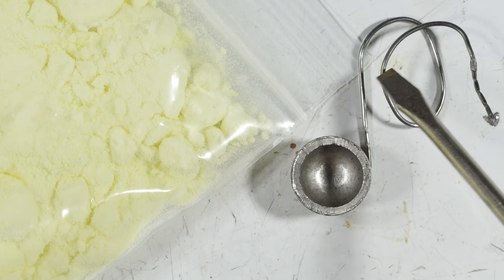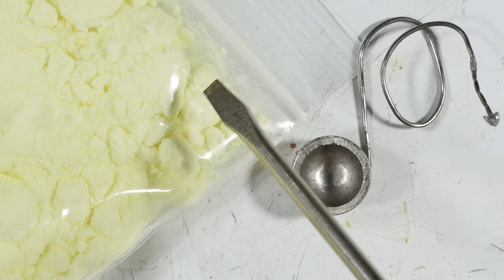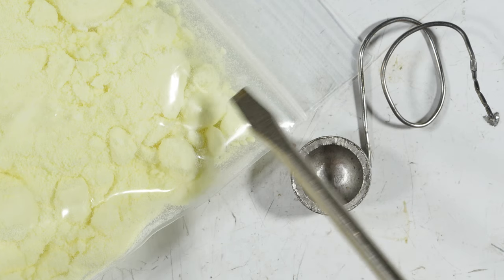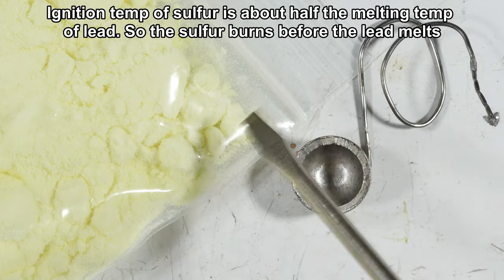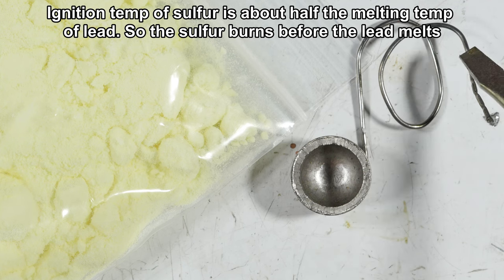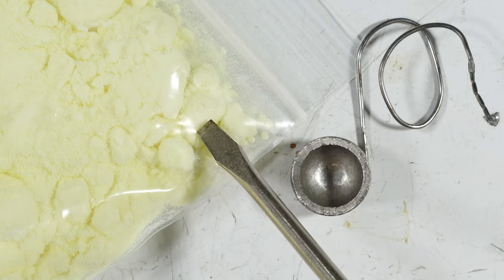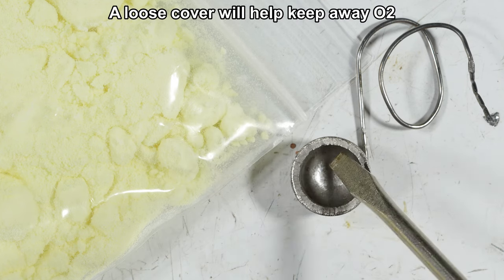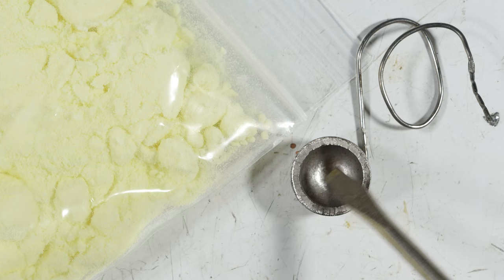If you're a chemist, you would do that in some kind of a situation where the sulfur won't catch fire. But what happens is, if you put exactly that 6.5 to 1 ratio, the sulfur will catch fire, it'll burn in the air, and then your ratio will decrease, and you will no longer have that ratio. So what I'm planning on doing is just getting about 10 grams of solder, so enough to basically fill this. Mix it with enough sulfur that there'll be excess sulfur, so that when it burns away in the atmosphere, there's still enough left to react with the tin and lead in the solder and give me my mixture.